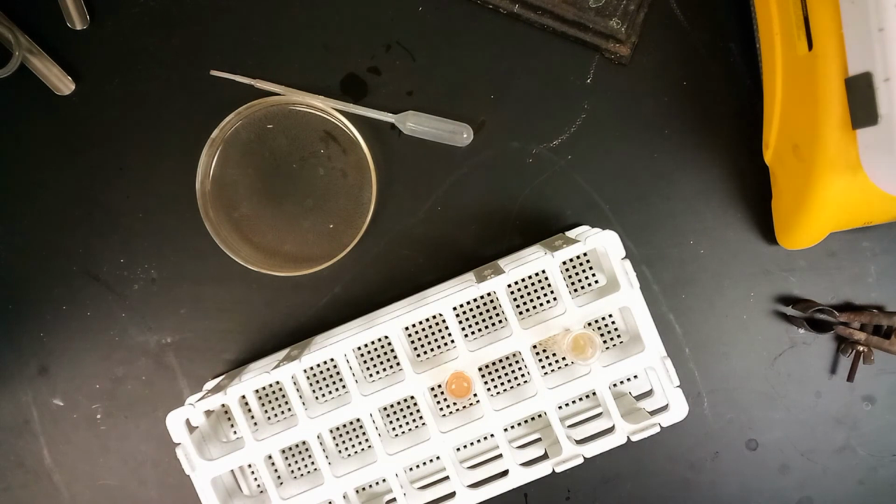And then I guess we'll go into part B. Sorry, this one's a little bit long. There's just a lot of steps and a lot of things to add. So it is what it is, but hopefully that helps.